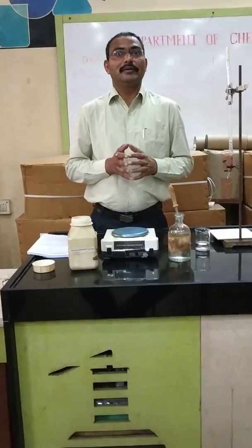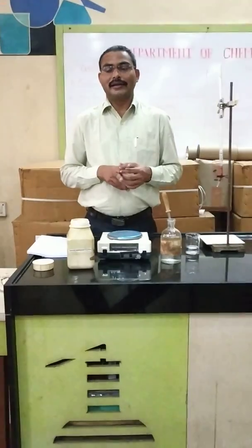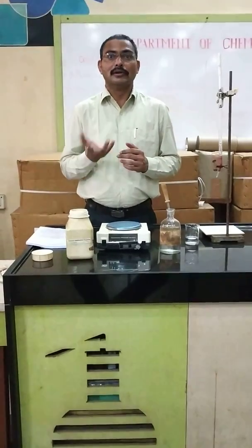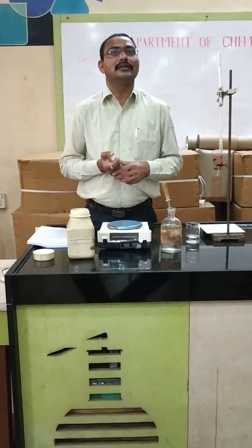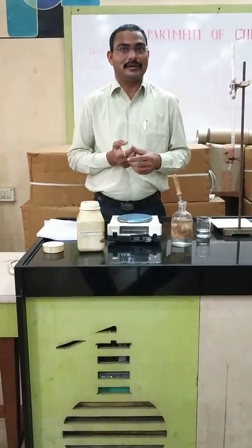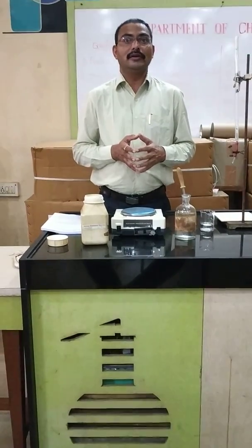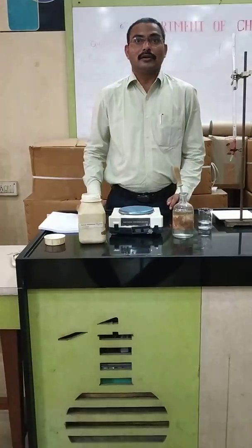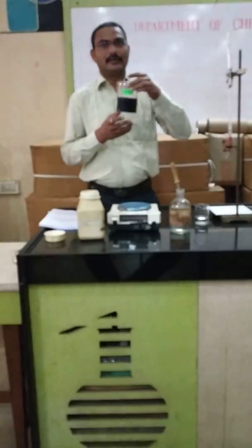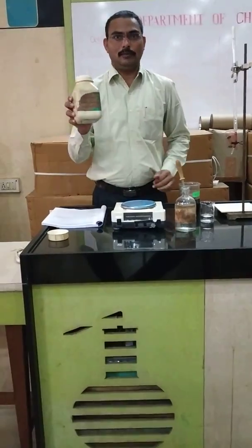But for our syllabus, for 12th standard, there are only two titrations, and that is redox titration. In 11th standard you learned that redox titration is nothing but oxidation and reduction reactions going on simultaneously. That reaction is called a redox reaction, and this is a redox titration — between potassium permanganate (KMnO4) versus ferrous ammonium sulfate.